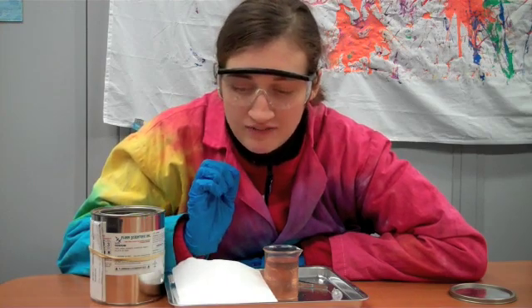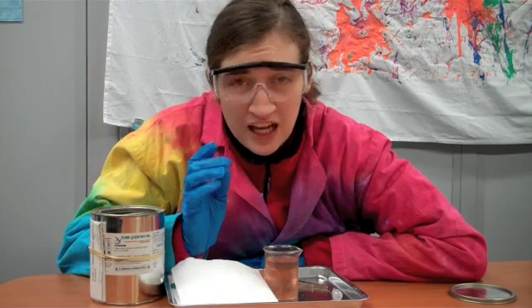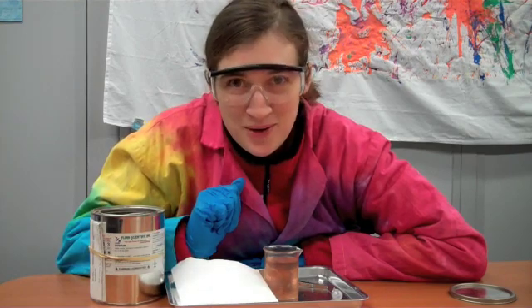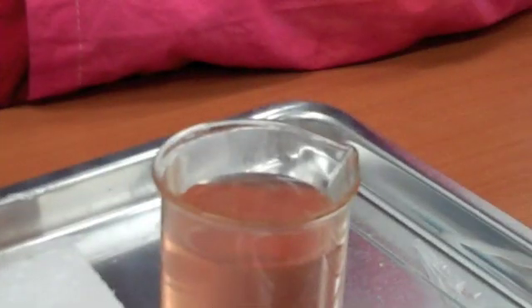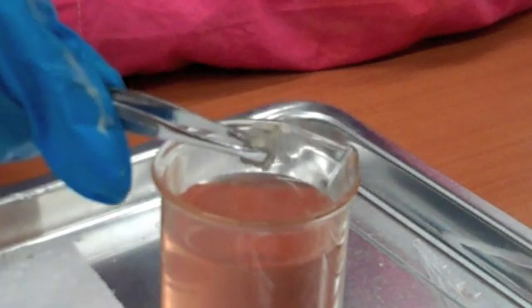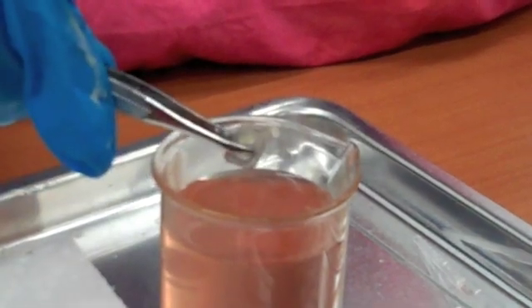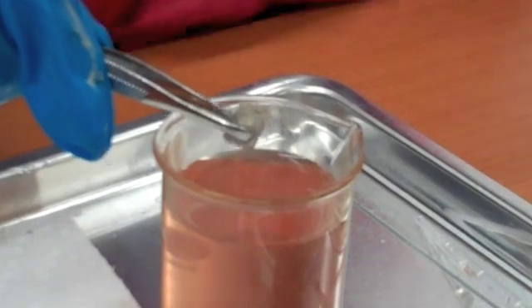And, well, if you don't know what happens when there's a lot of heat and a lot of hydrogen gas, we're going to show you. So now I'm going to put this little chunk of sodium in the water with the indicator and we'll see what happens.